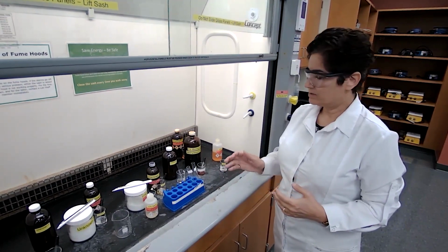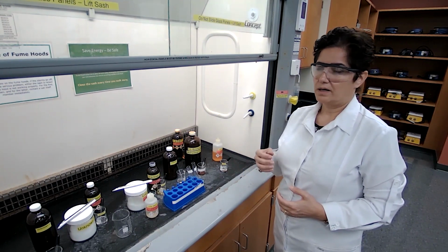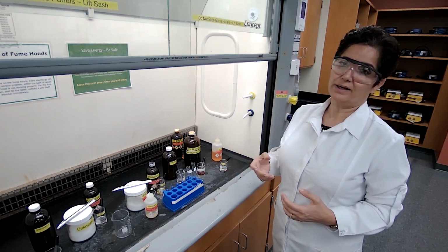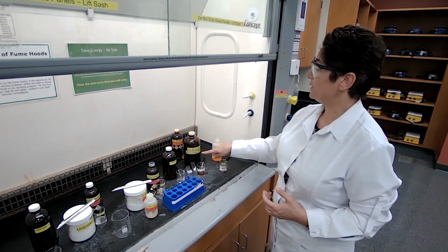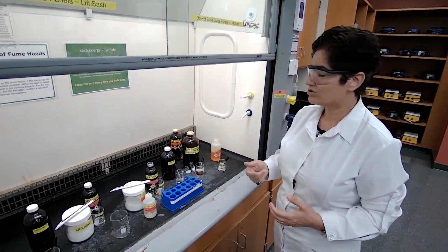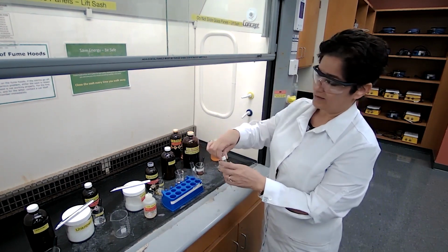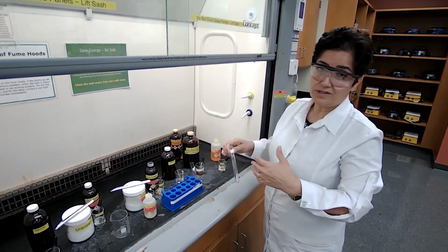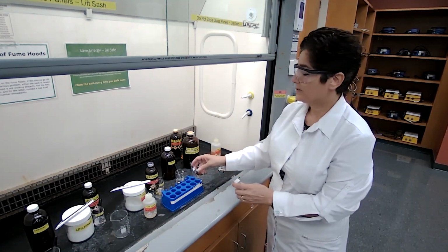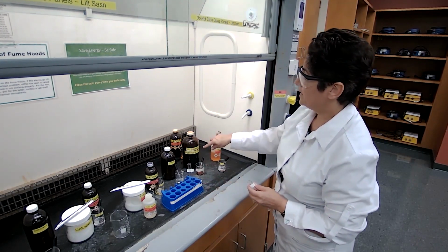The classification test that we are using to determine if the unknown is an unsaturated hydrocarbon, like an alkene or alkyne, is the use of bromine in methylene chloride or carbon tetrachloride. Bromine is the reagent actually. It's a test for unsaturation. The only two unknowns we are worried about right now, that we know are not ketone or aldehyde, are unknown 1 and unknown 4. So we are going to test both of them with the bromine.